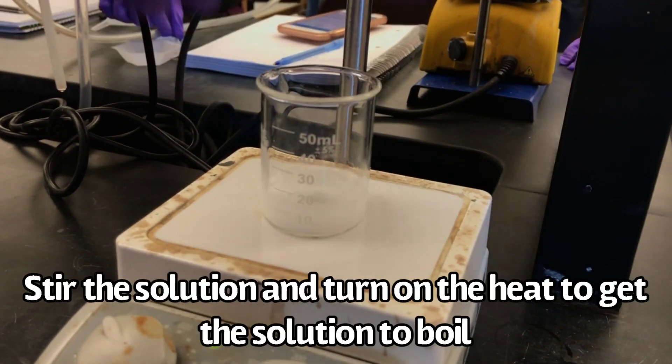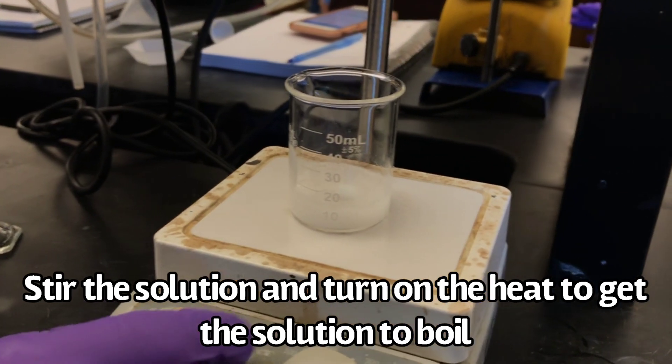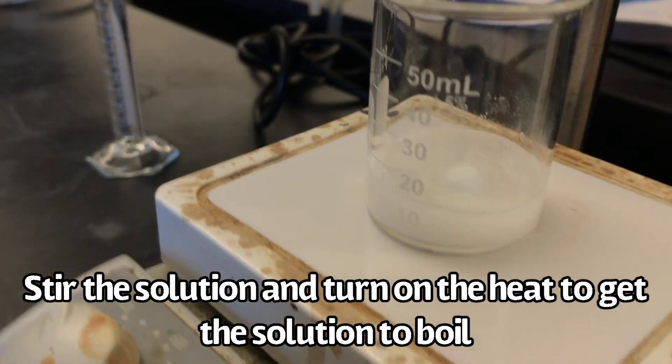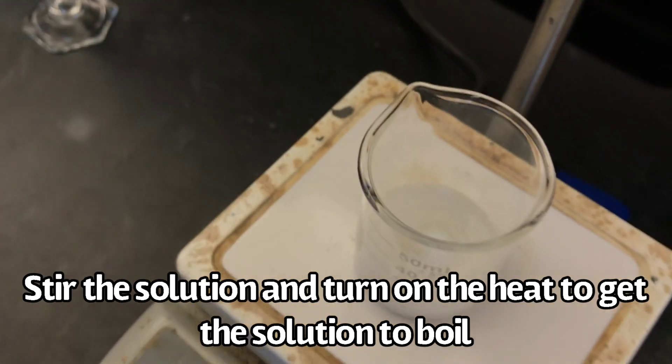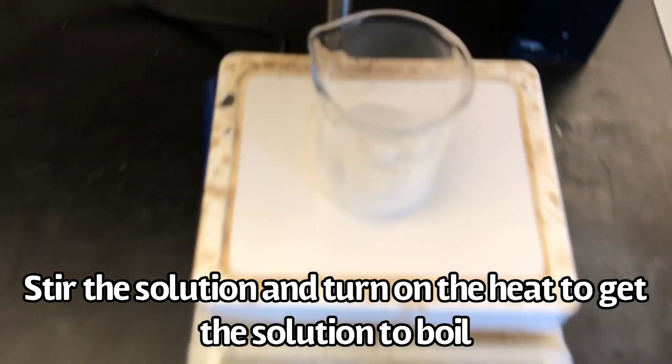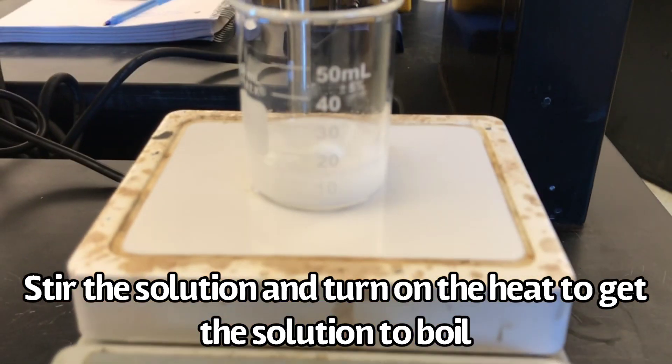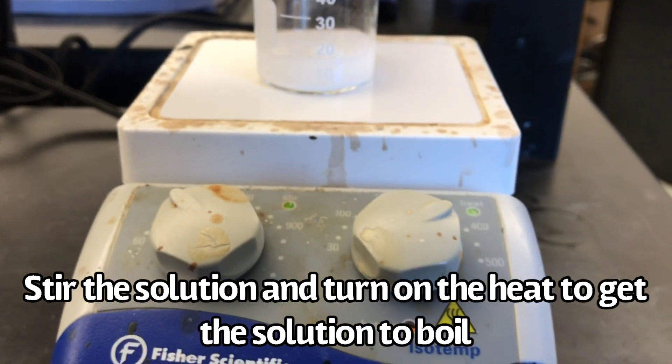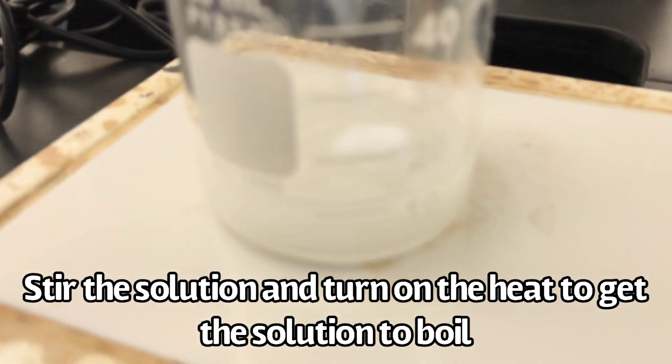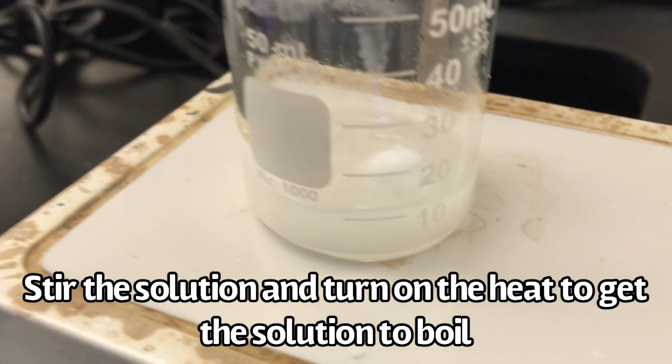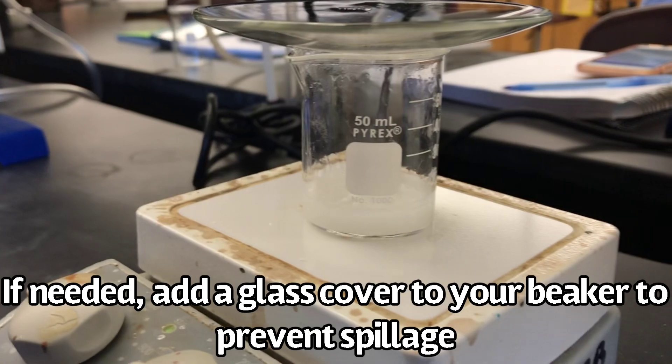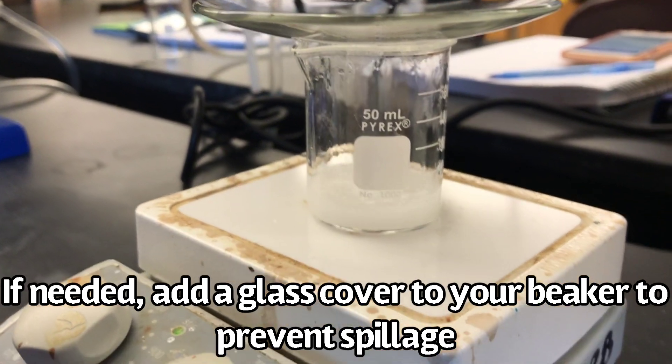Stir the solution and turn on the heat to get the solution to boil. If needed, add a glass cover to your beaker to prevent spillage.